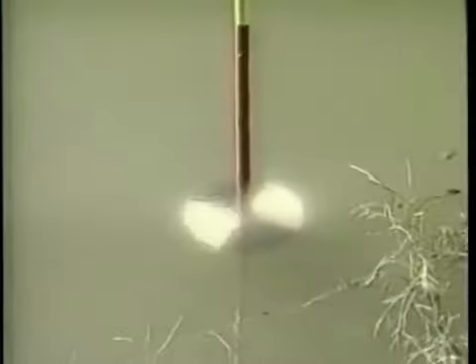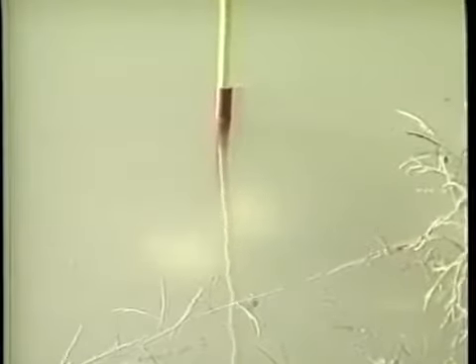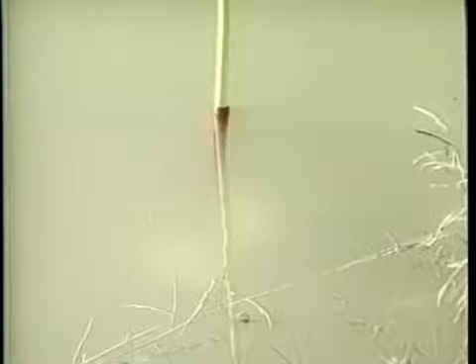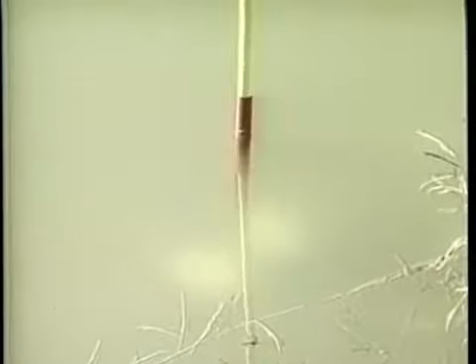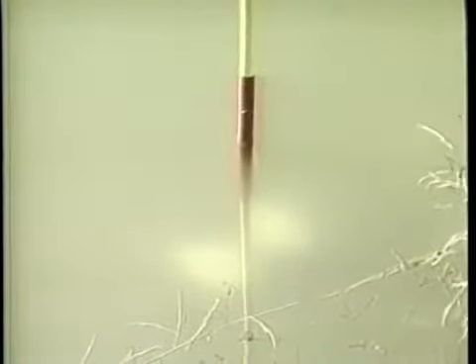To obtain the Secchi disc visibility reading, the disc is lowered into the water until it just disappears and the depth is recorded. The disc is then lowered a little deeper and then raised until it just reappears. The depth at the reappearance of the disc is also recorded. The average of the two readings is the Secchi disc visibility.